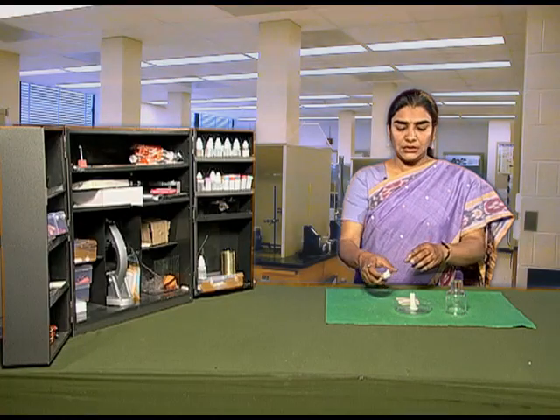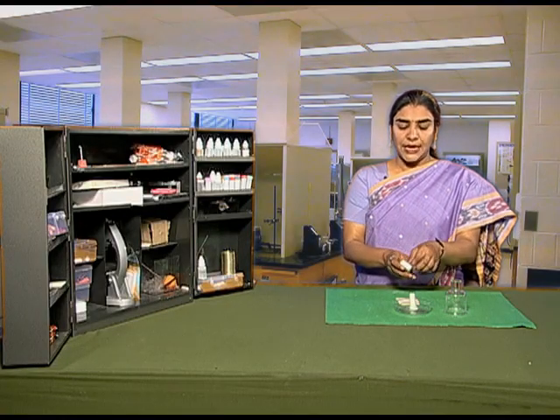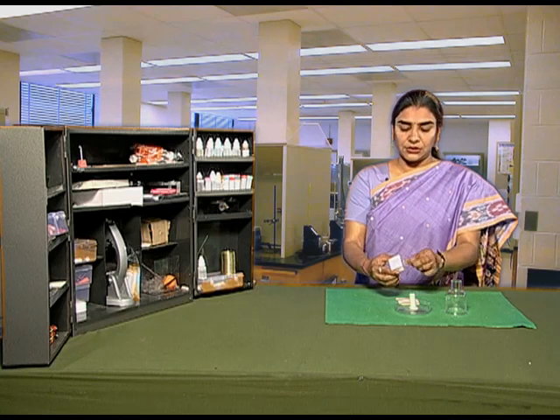First, let us light the candle which is fixed in the Petri dish.